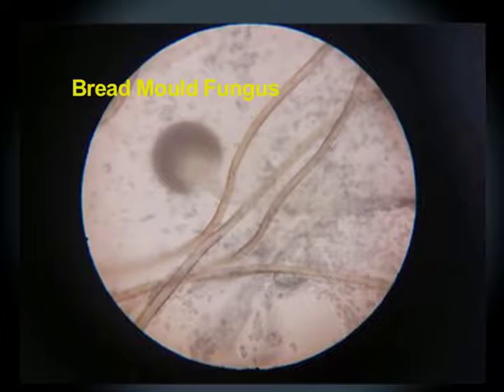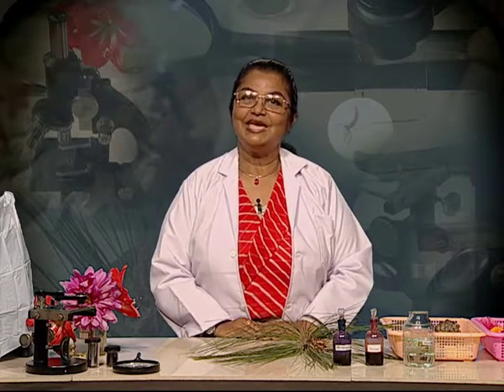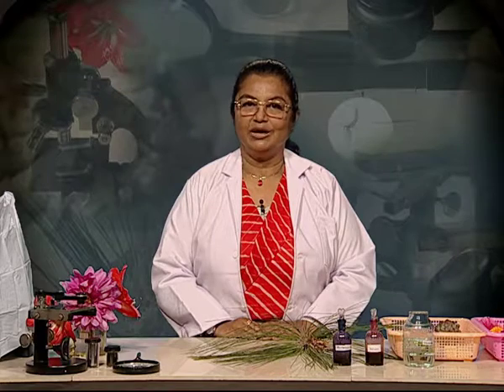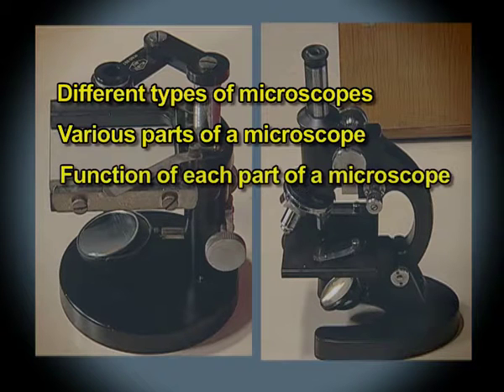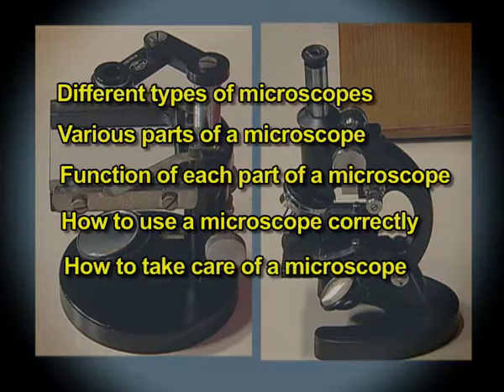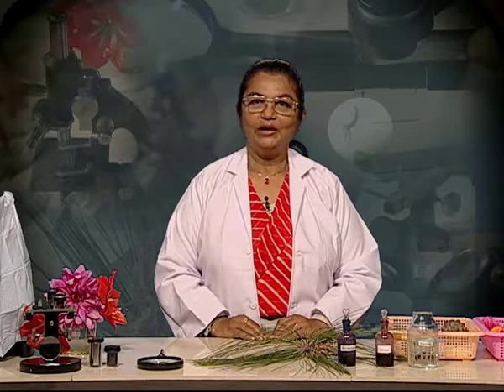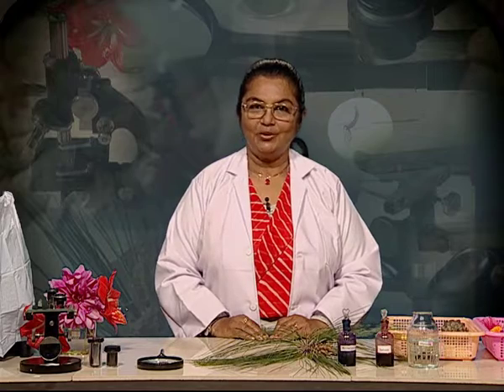Thread and pinhead-like structures that can be seen only under the microscope of bread mold fungus. Don't they look amazing when viewed through the microscope? So friends, in this video, we are going to learn about different types of microscopes, various parts of a microscope, function of each part of a microscope, how to use a microscope correctly, and how to take care of a microscope. We are going to look into three types of microscopes which are generally used in school laboratories.